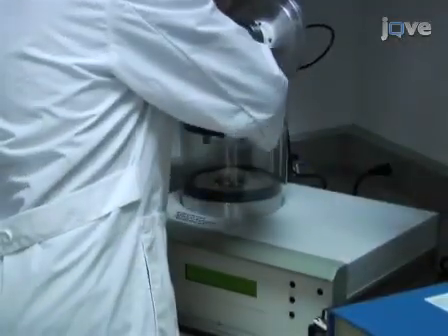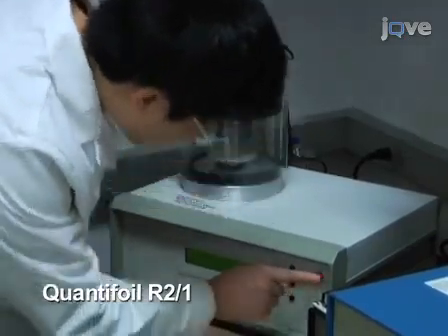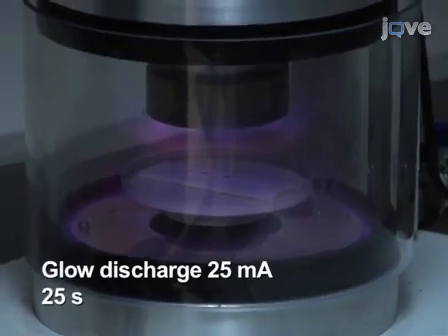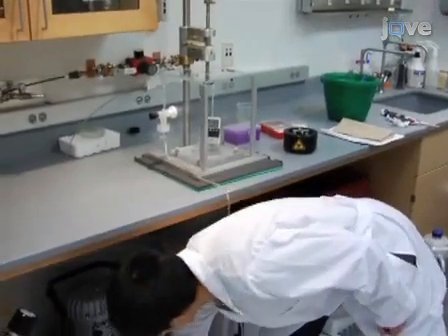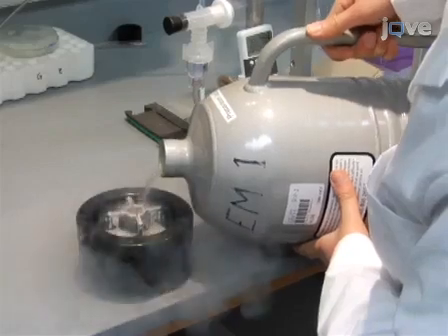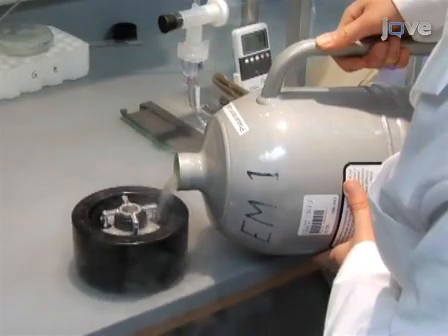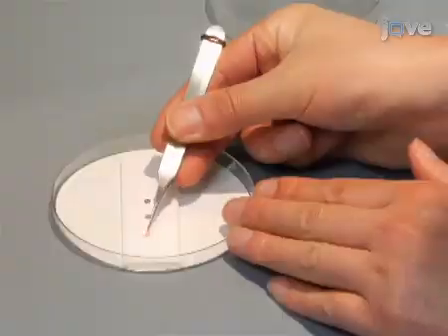To prepare the HIV-1 capsid protein assemblies for cryo-EM, begin by glow discharging the carbon side of 200 mesh copper grids under 25 mA for 25 seconds. Use a nebulizer to bring the humidity to 80% in the environmental chamber, which is a homemade manual gravity plunger. Meanwhile, cool liquid ethane in a Vitrobot plunger dewar with liquid nitrogen. Mount the plunge freezing dewar onto the manual gravity plunger.